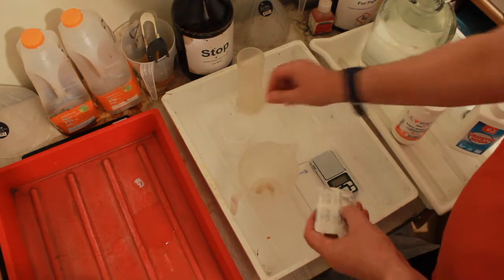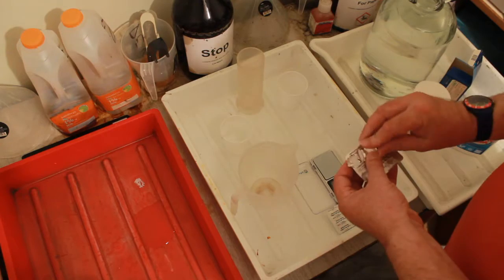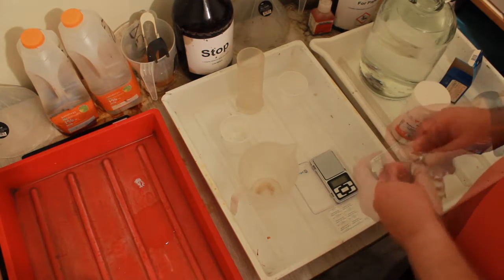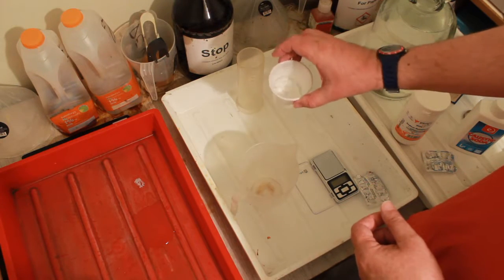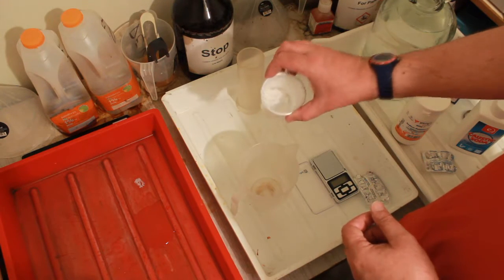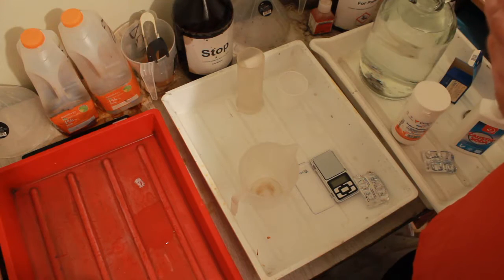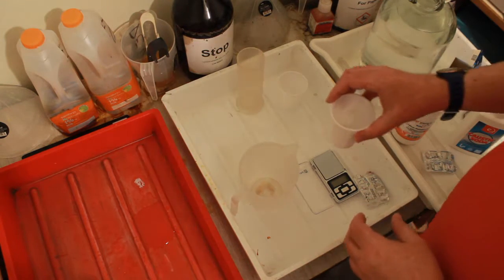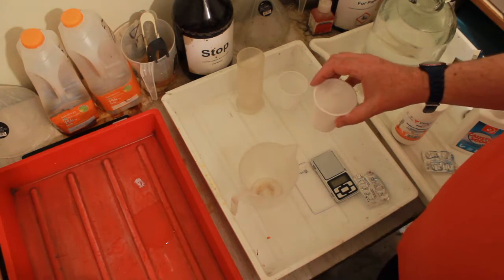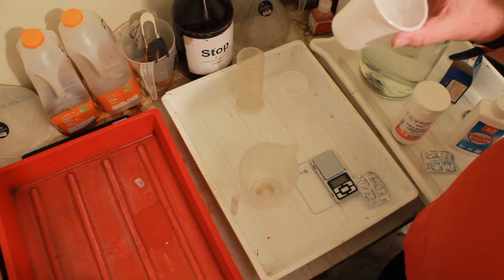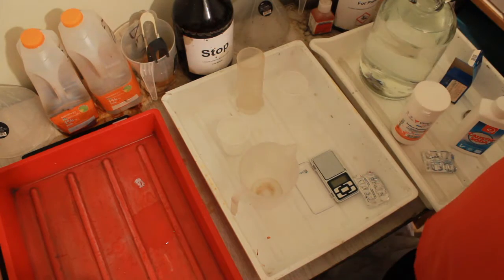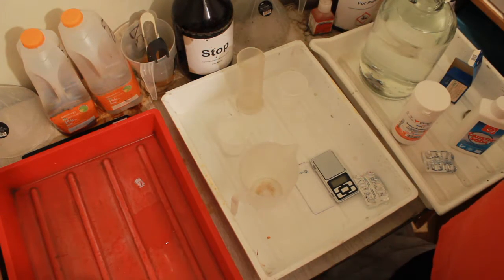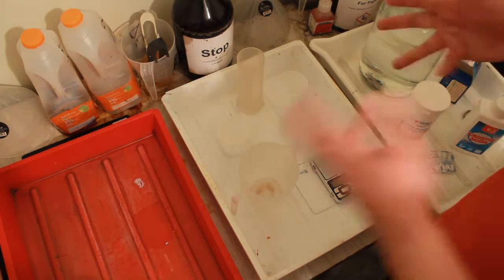This might take a while. Come back in a minute. There we go, in there now there are 20 paracetamol tablets, you might be able to see them. They're slowly falling apart, that's good. I was really worried that they wouldn't. I haven't got anything to grind them with, you see.